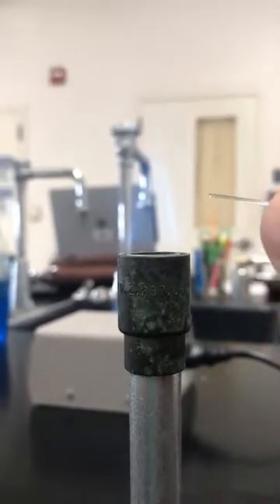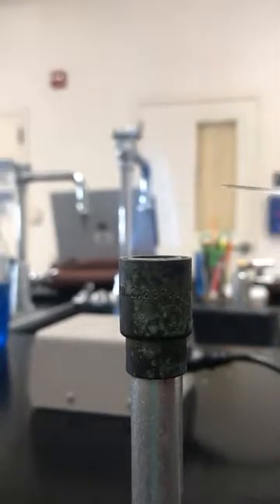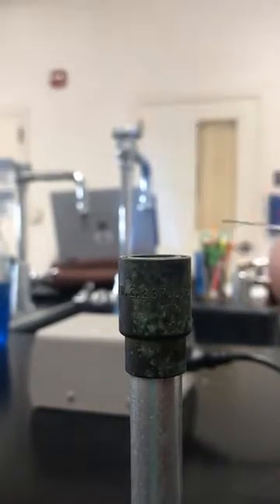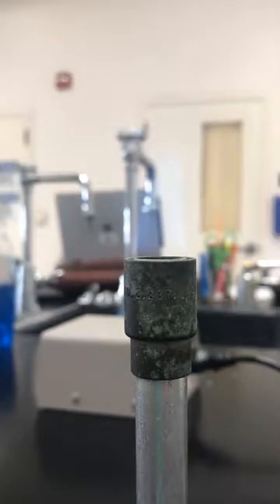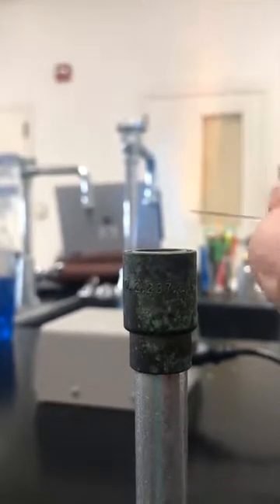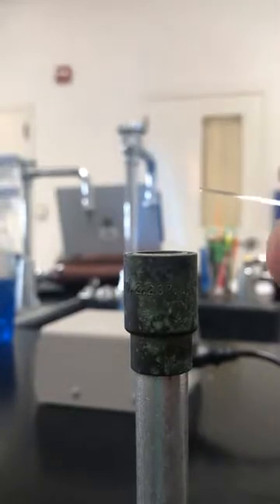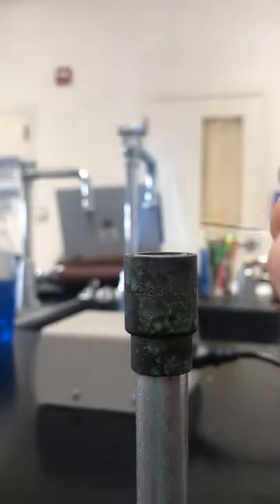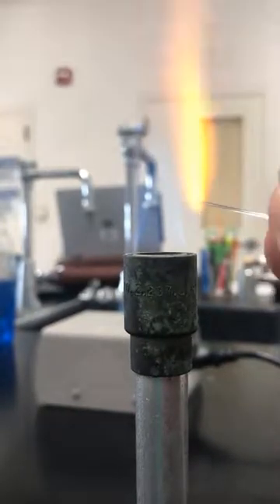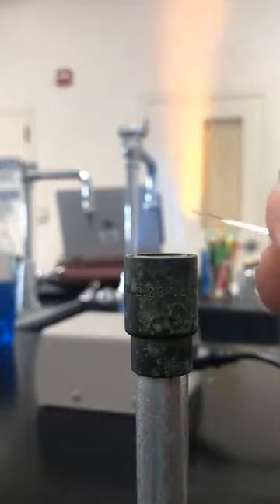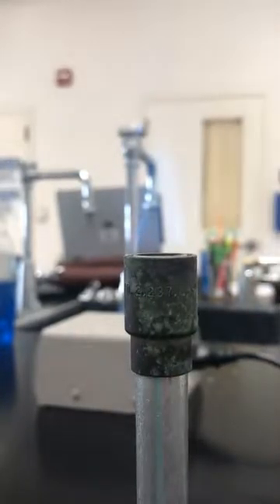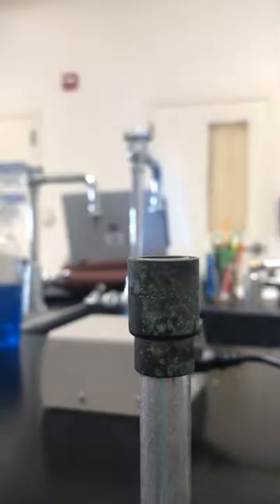I usually use a stereo microscope to make sure it's melted shut. It's only going to be melted shut on one end, and you don't want to hold it very long. Yeah, that looks like it's good.